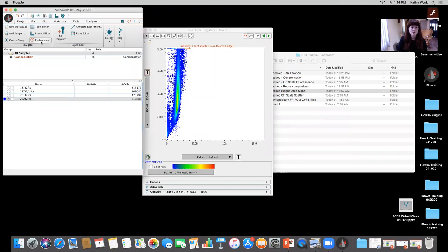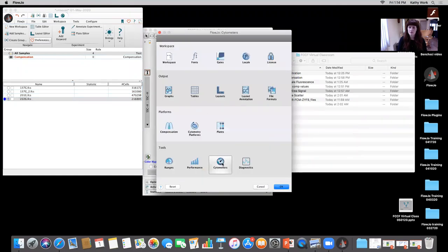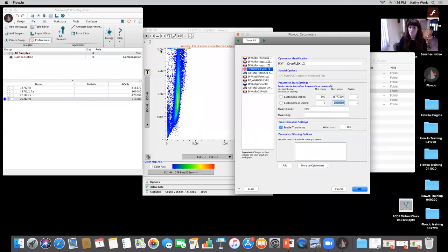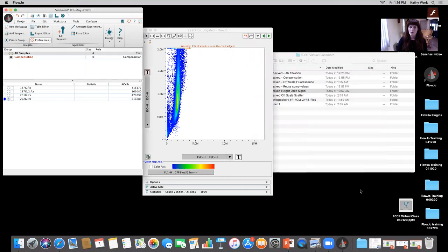What I prefer doing is going into preferences. And when I go into preferences, if I go into cytometers, what I have the ability to do is go to Cytoflex, and I can use either custom or default, or I can change the custom linear scaling, right? 2 million, where it was just maxed out before over here, to 16,777,216. Okay. So now when I do that, for all detectors that I have in linear, it's automatically going to go to 16,777,216. This way you don't have to use that transform button each and every time for height, for area, for all these different parameters that you might be looking at for scatter.